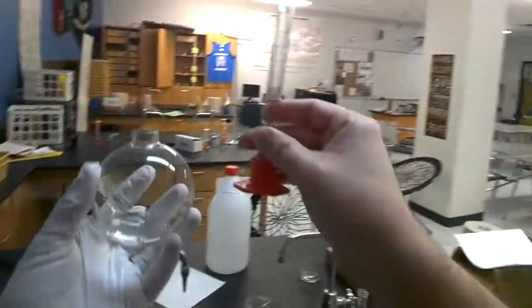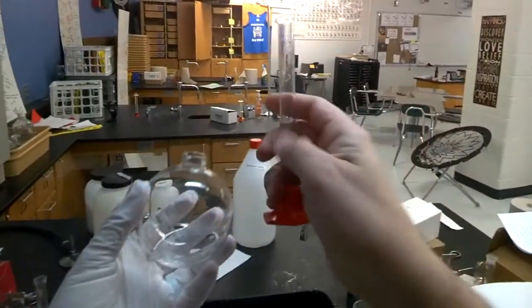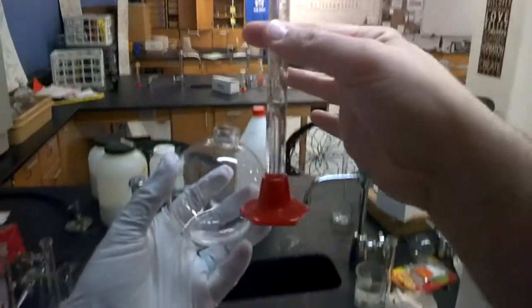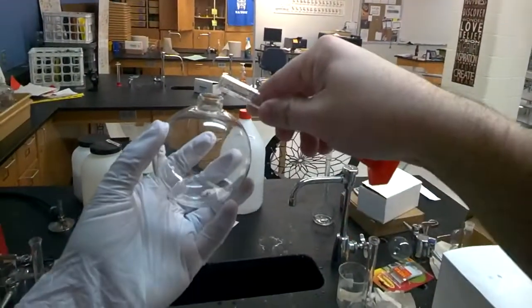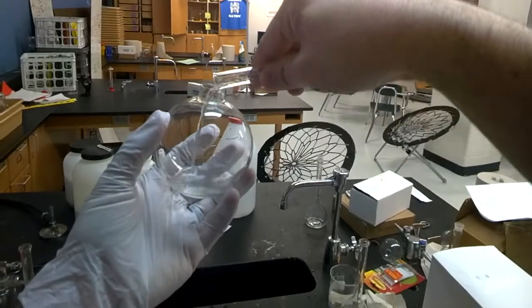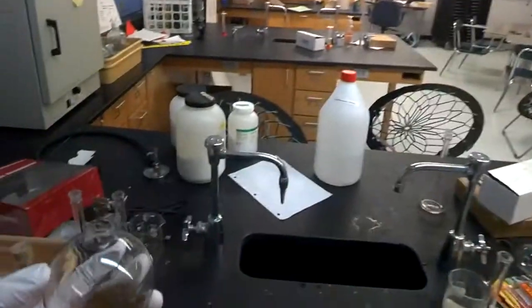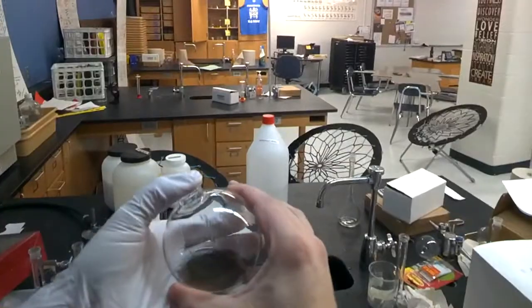So now I've measured out five milliliters of sodium hydroxide here into this graduated cylinder. I'm going to add it and when you do you should see an immediate reaction. Yeah there we go. There's that nice brown reaction. Now comes the shaky shaky shaky.